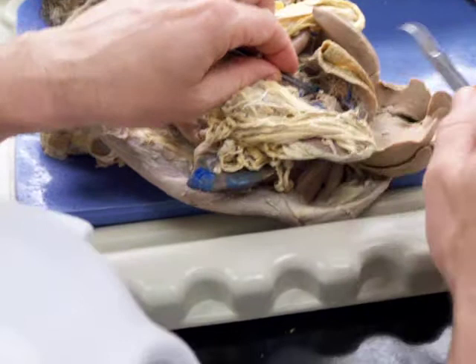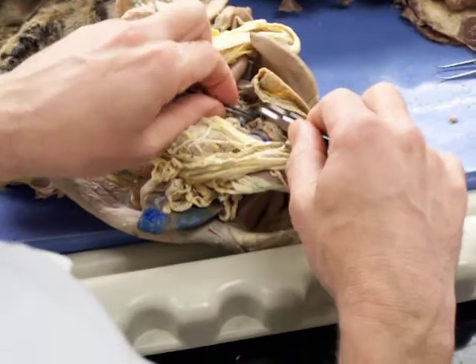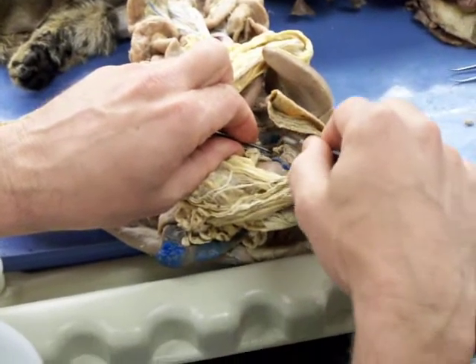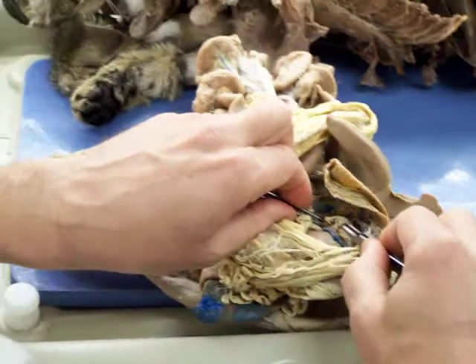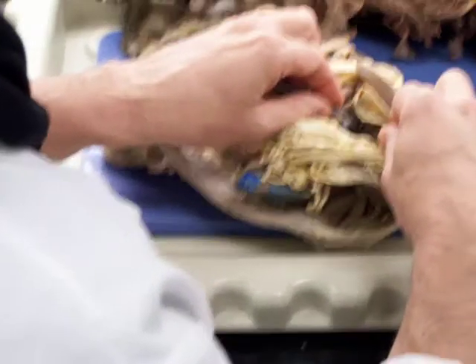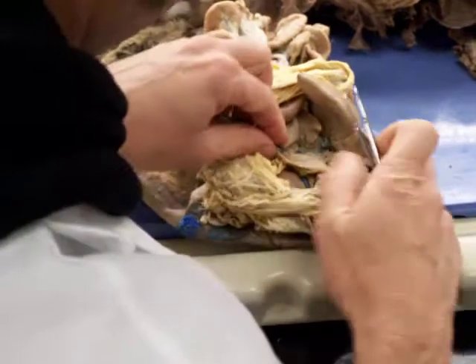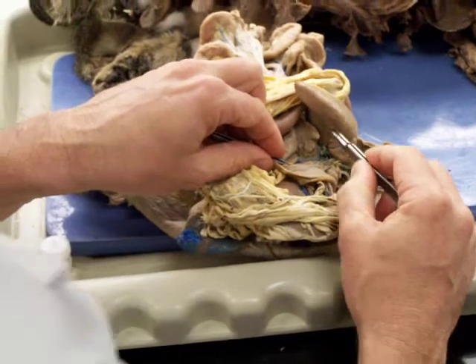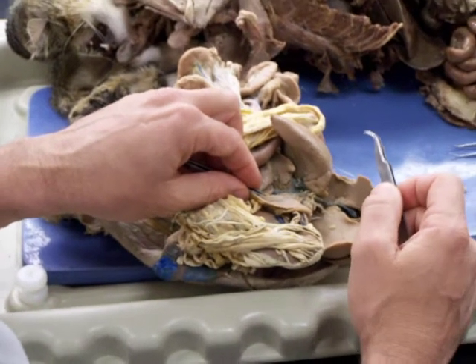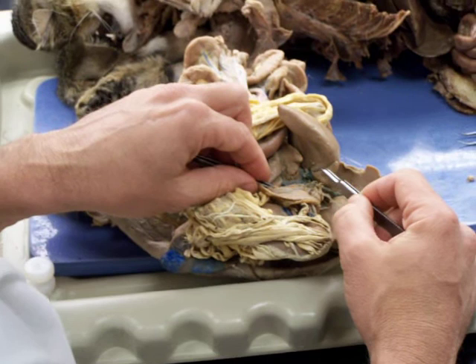Okay. Now at the same time we can see this one that comes off with it, and you can see how that's distributing to the lesser curvature in there. This was the left gastric that we saw before. And this is the hepatic. And generally it runs up to the liver, up in here, and it's going to supply blood to the liver, hence the name. And I'll get back to that in a little bit.